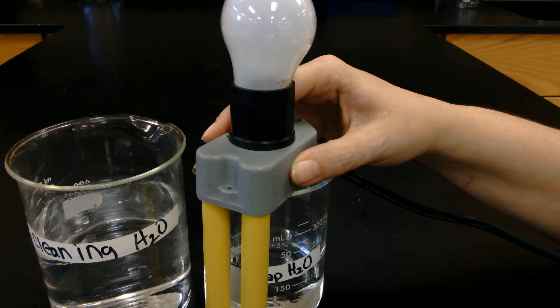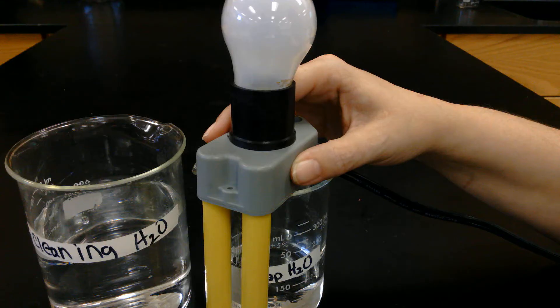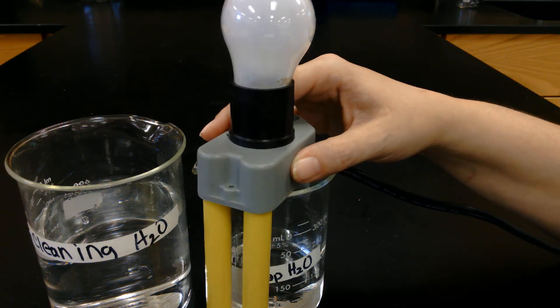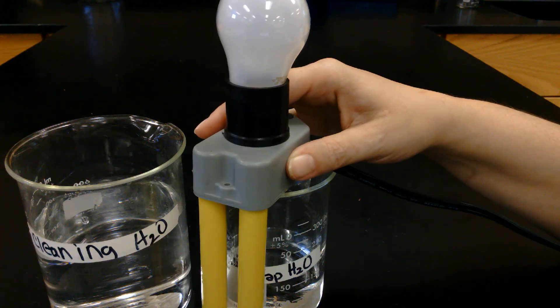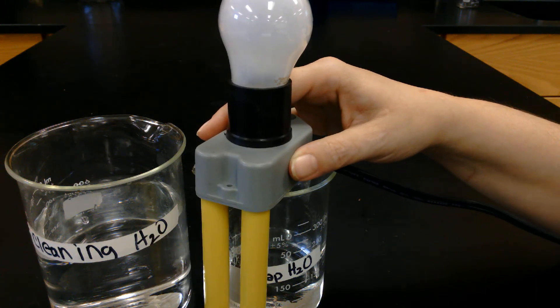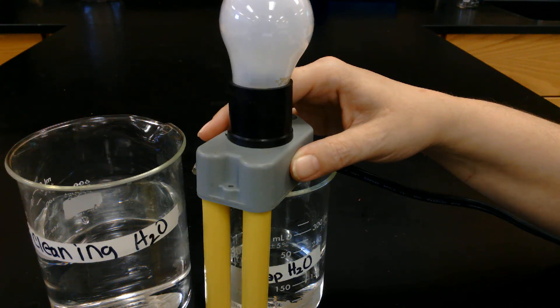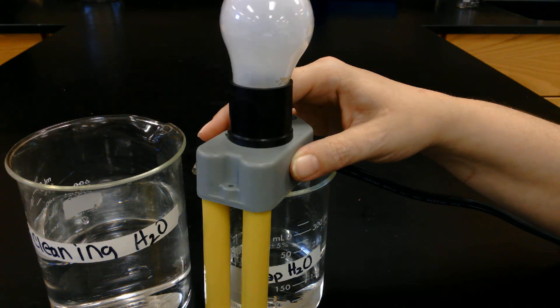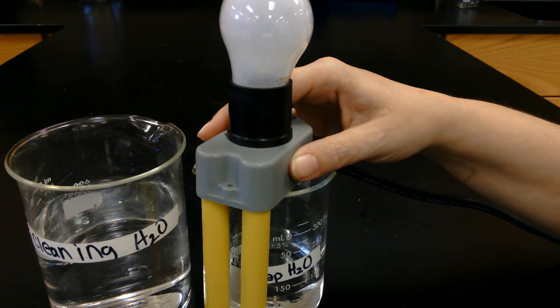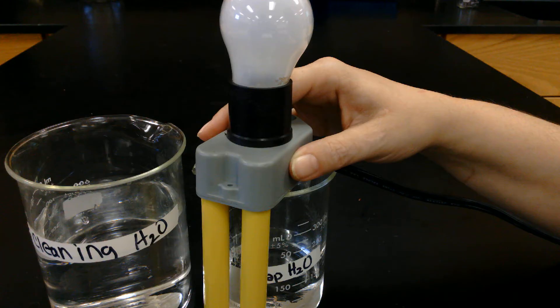Ionic compounds dissolved in water or melted are electrolytes. An ion is a positively charged or a negatively charged ion, which allows conductivity to flow through and light up our little bulb. As we go through the different solutions, you will either mark it as yes or no on your teacher-made sheet for an electrolyte.